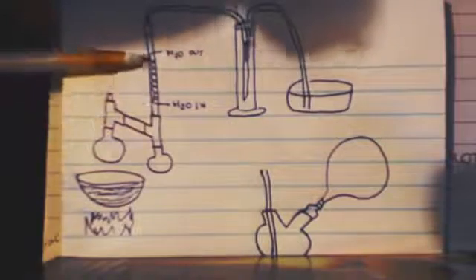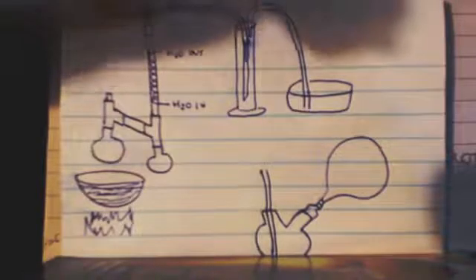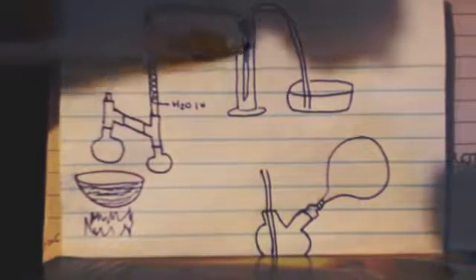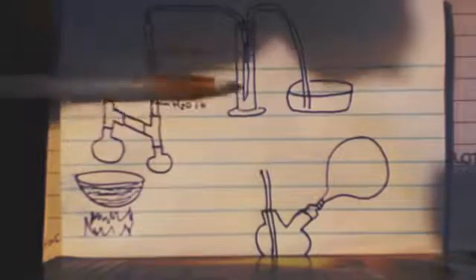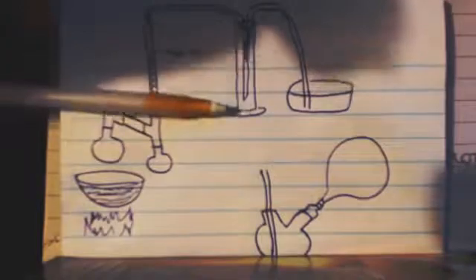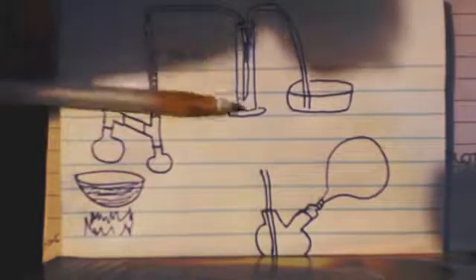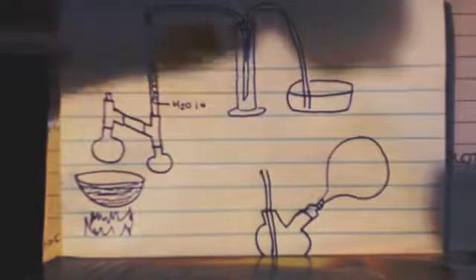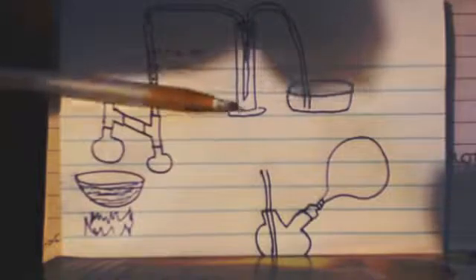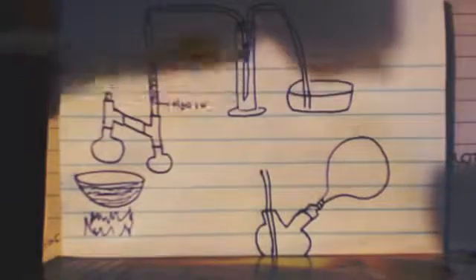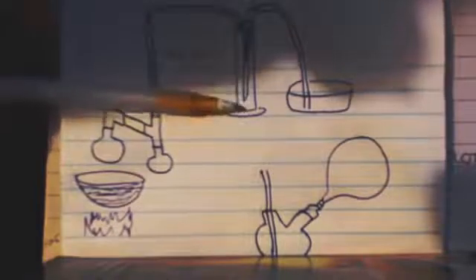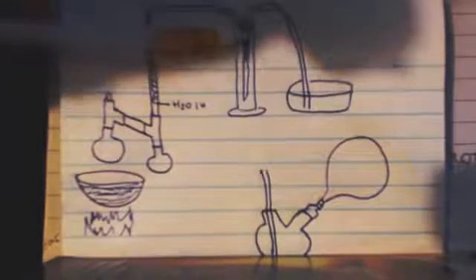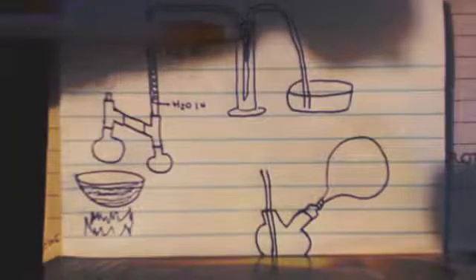Your carbon dioxide will come up, it's not going to be condensed, obviously. I would put some kind of drying agent in this graduated cylinder - calcium chloride or magnesium sulfate. I would cap this off. Your gas comes in, goes to the bottom, then it has to travel through all that drying agent before it comes up to this tube and comes out, and then you can bubble it into your product.